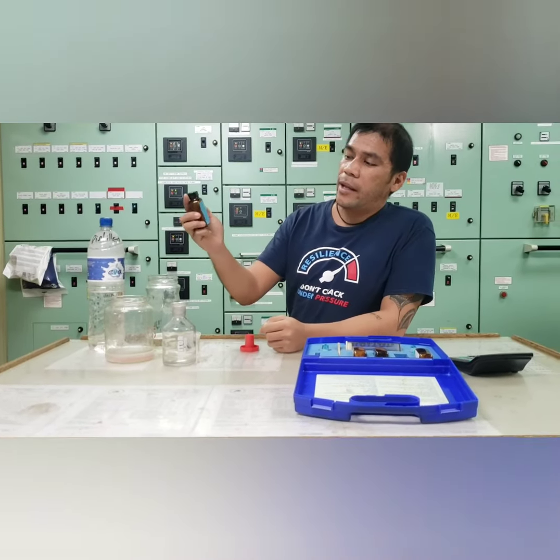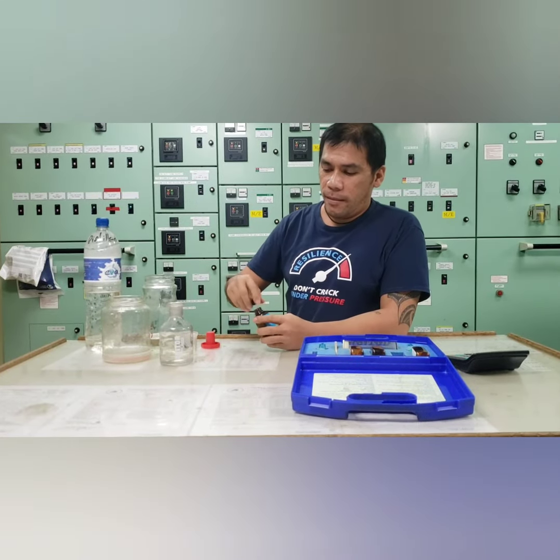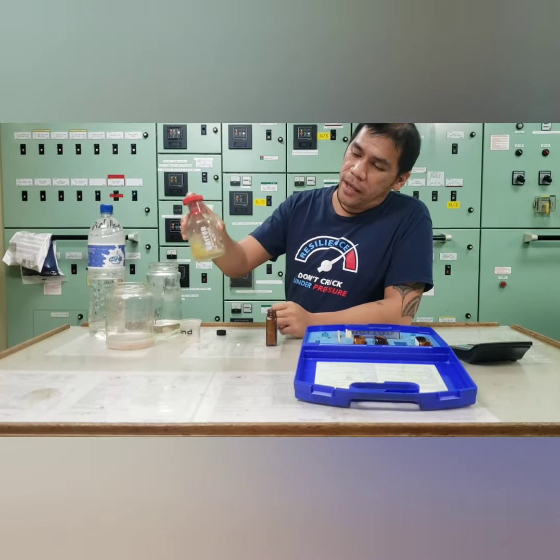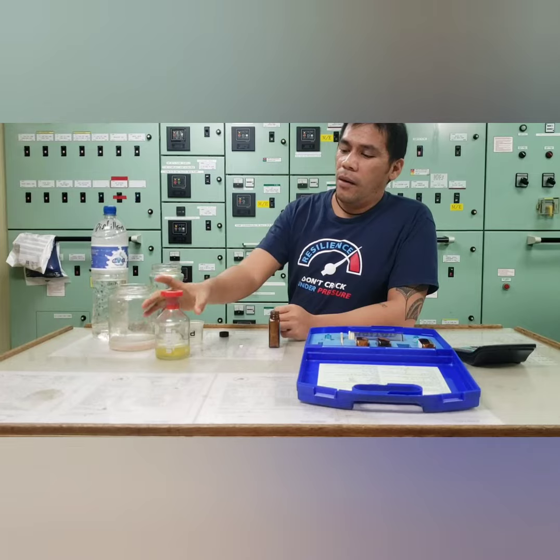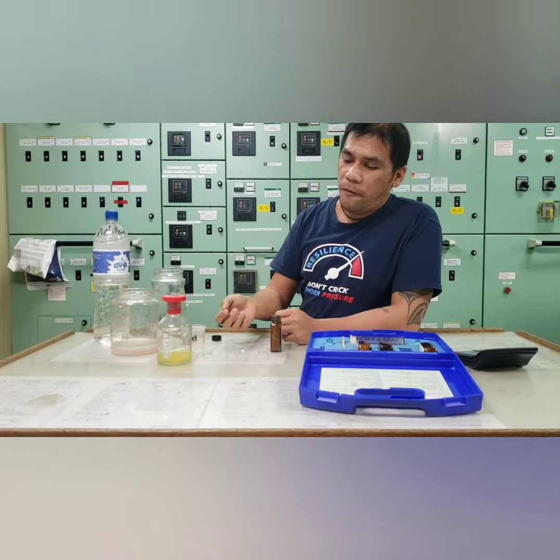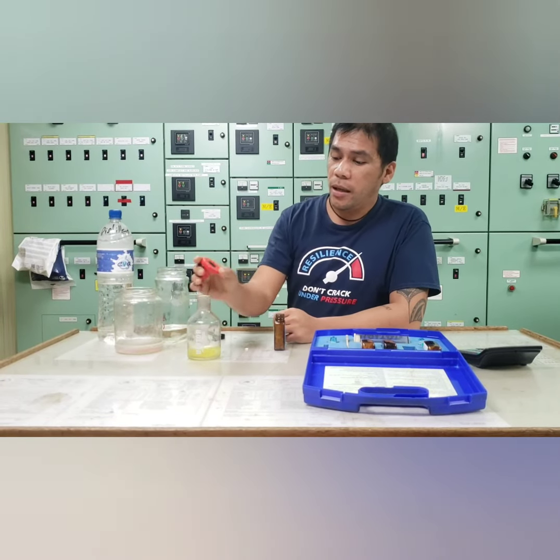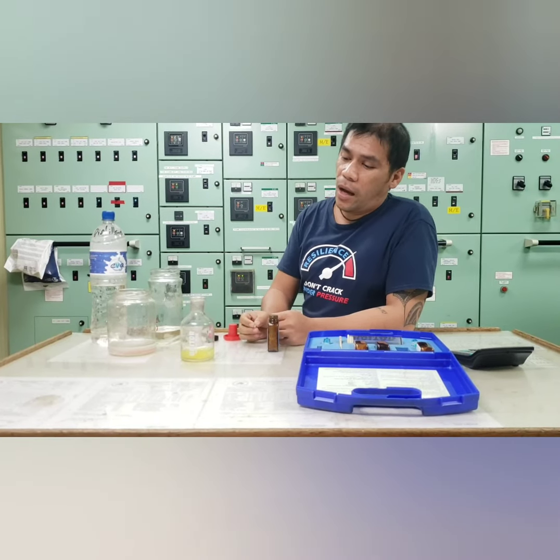So we have the chloride tablets. So we use the 50 ml sample. We will add 1 tablet to know if there is a salt content in our system. Now it turns into yellow. So means we will going to find the color turn into red brown. So when the color turns into red brown, means to say that's the time that we're going to compute how much chloride content of our water.